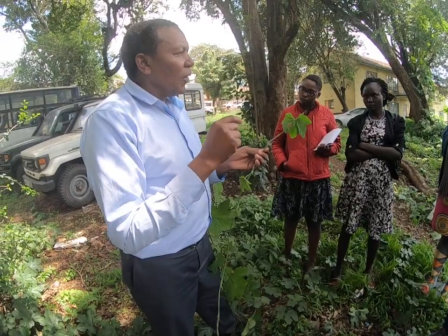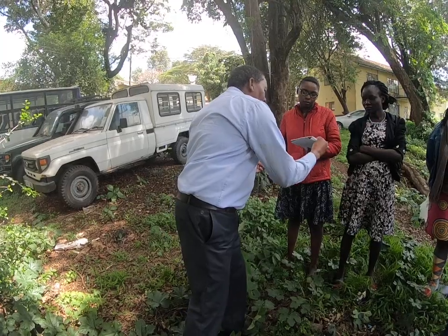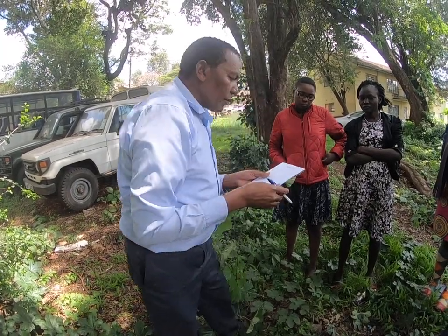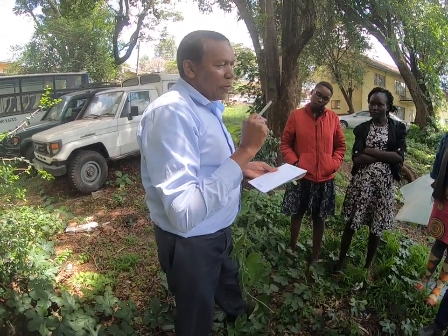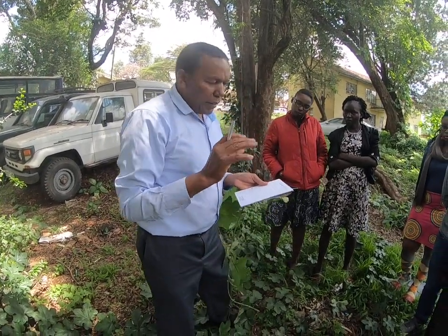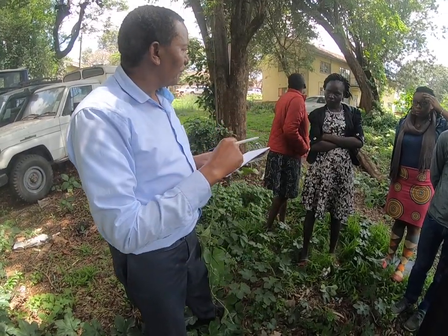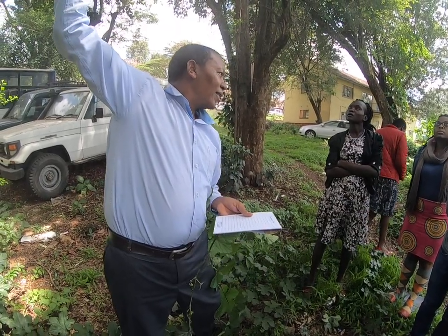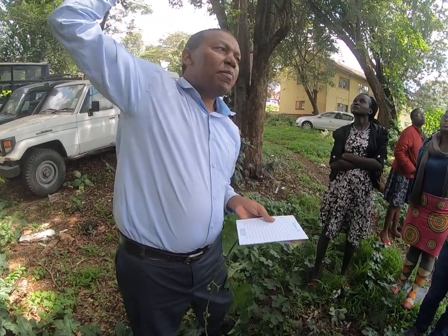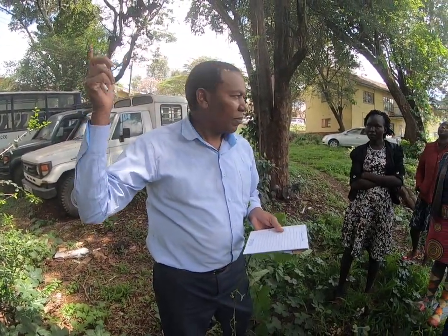But now, because the taxonomist will not be with you in the field, you also have a notebook. And in the notebook, this is the information you collect. You describe the plant. It's a creeper. It's creeping like 5 meters. It's also a climber. Look at that. It's also climbing like 5 meters high up. So it can creep, can also climb.